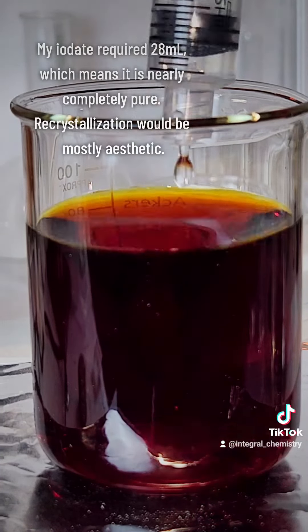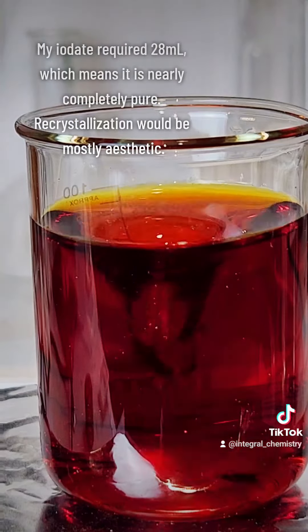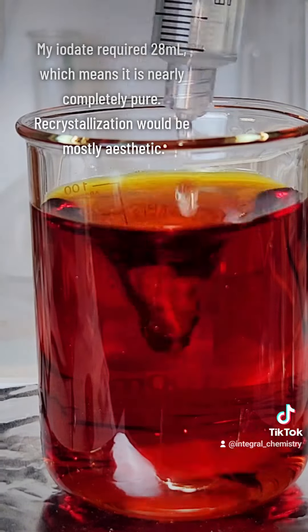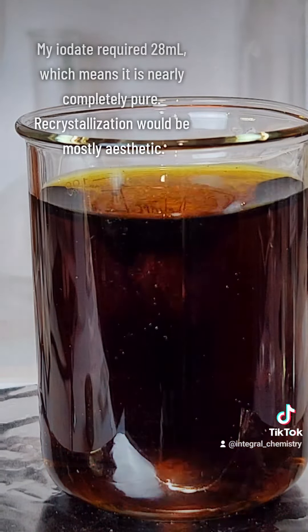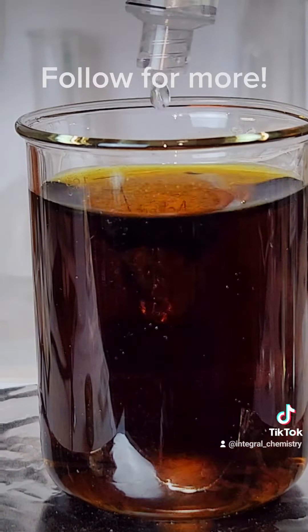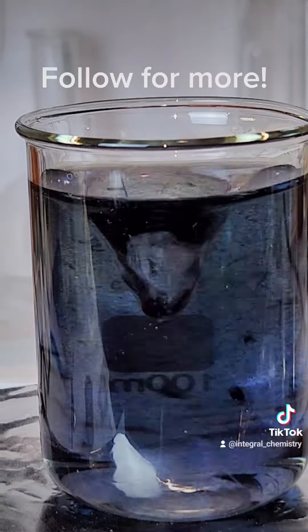The 12 milliliters required to titrate my tap water are likely due to chlorine or some other sterilization products. In any case, my sample required 28 milliliters to titrate, which means it's basically completely pure and a recrystallization is unnecessary.